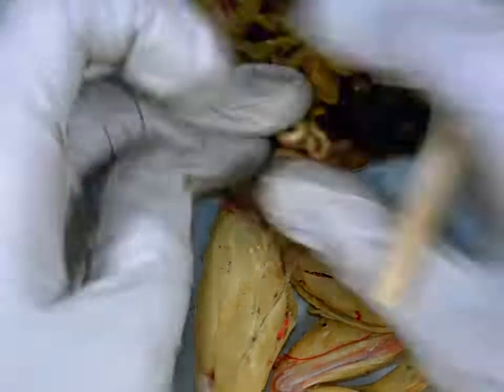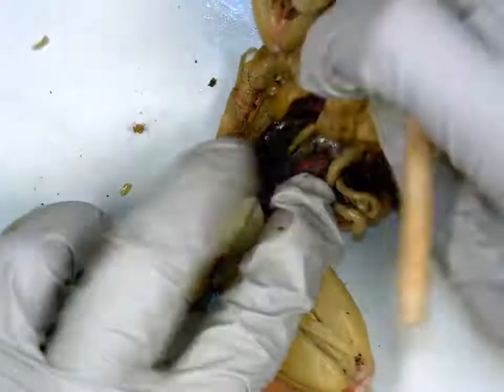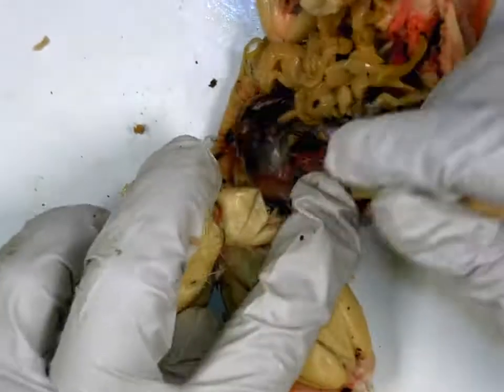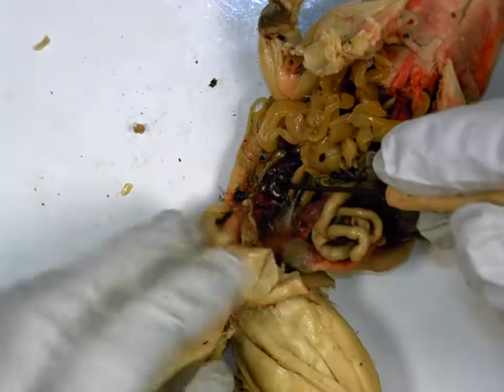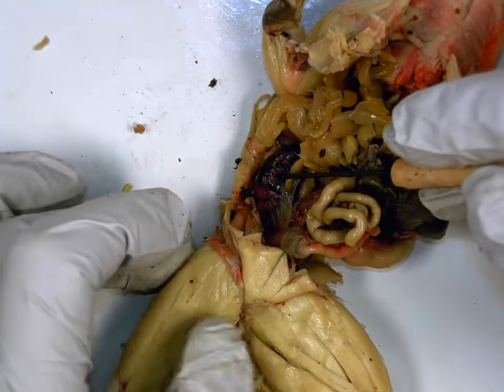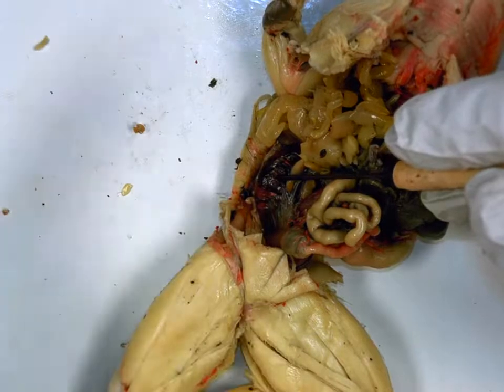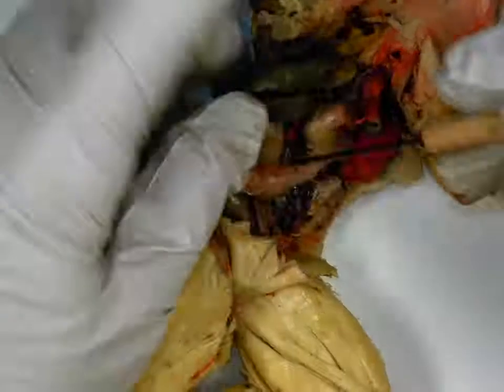Now, for the reproductive tract, it depends on which frog you have, whether it's male or female. This is a male. And if it's a male, you're going to have to look way in the back, and sealed onto the back wall are these dark structures. What are these dark ones sealed into the back wall? Kidneys. 3 functions of the kidneys. Remove salts, remove excess water, and filter metabolic waste.